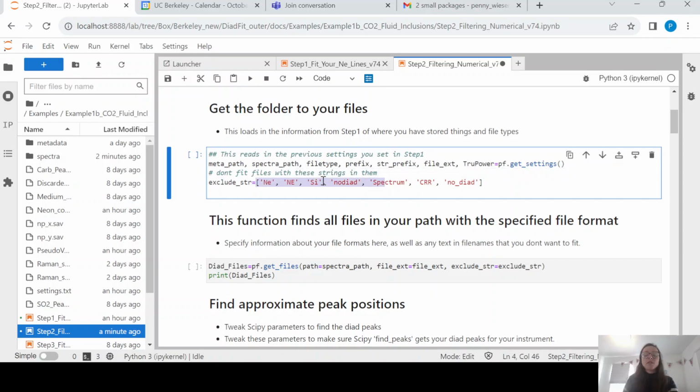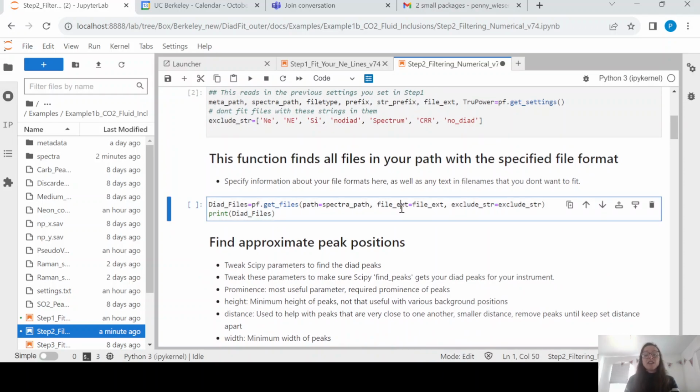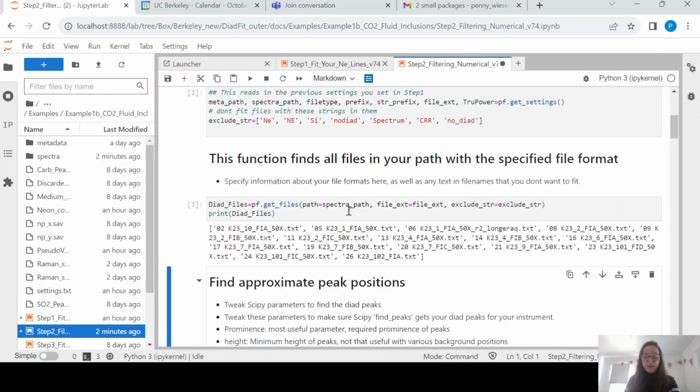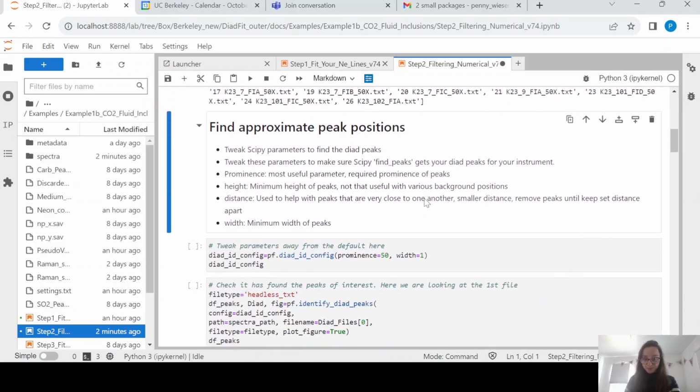list out all of the names of things which are not your diad files. So here we're excluding our neon lines, we're excluding acquisitions we took on the silica chip at the start of the session, we're excluding files where I labelled them no diad, they don't have a diad, there's no point in wasting my time fitting them, and various other things. Some of them I put no underscore diad, so that's why I've got that here. Okay, and now we're going to get our diad files. So we're looking in this Spectra path for the file extension for all of the files except those including this string. So you can see here is a list of the files that we are about to fit.